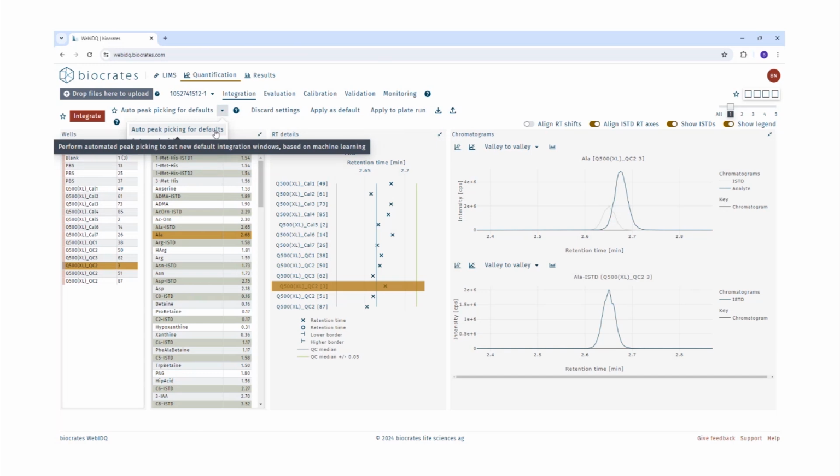Choosing auto peak picking for defaults will set the same default retention time ranges for each sample based on the quality controls. So auto peak picking for defaults uses quality control samples as reference. Choosing auto peak picking is only for specific cases such as matrix effects or shifts in the retention time. So we recommend using auto peak picking for defaults if there are no shifts in the retention times or there are no matrix effects. So the first tip here is, to save time and for having assurance during defining the peak integration windows, we recommend to use auto peak picking for defaults.